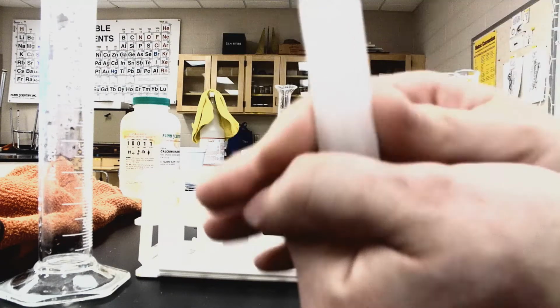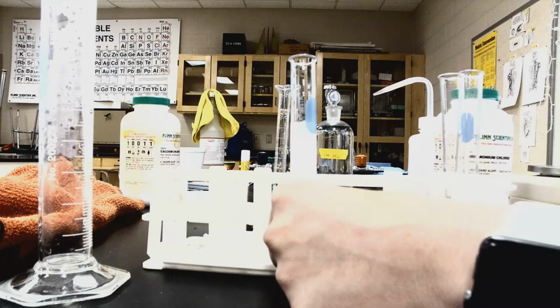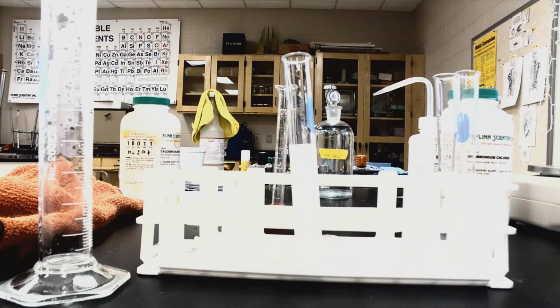As we touch this one, it's actually pretty cold. Put this back here. So as I'm touching this one, I'm going to be careful to touch it towards the bottom. And as I'm touching it, it's actually cold. You're going to use that information to record in your data table A and answer your questions.